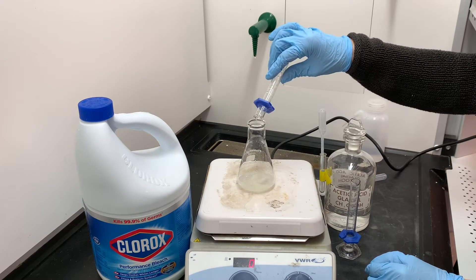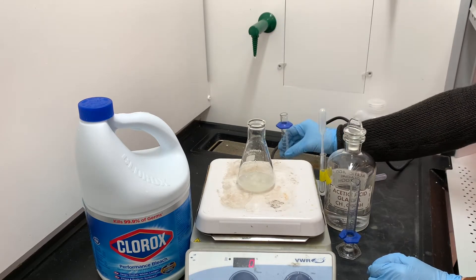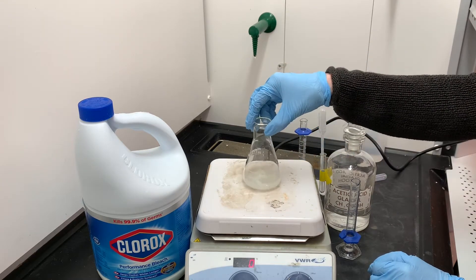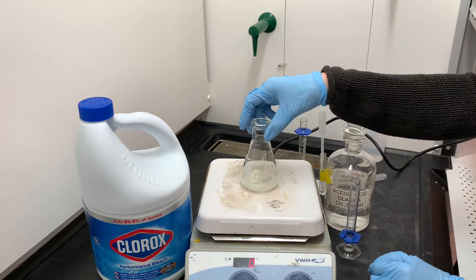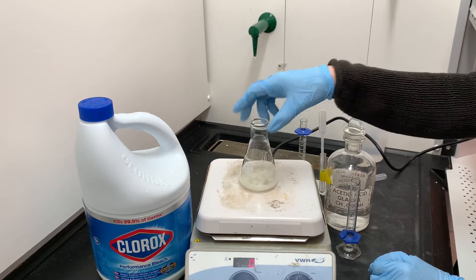One of the nice things about this experiment is that we are going to be monitoring the concentration of the bleach or the sodium hypochlorite through the whole experiment, so if I've not added enough I'll know and I'll be able to add some more.